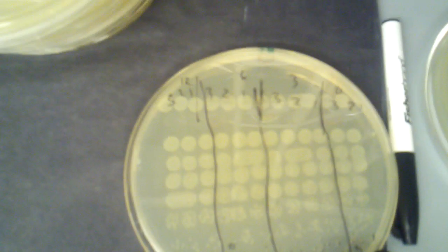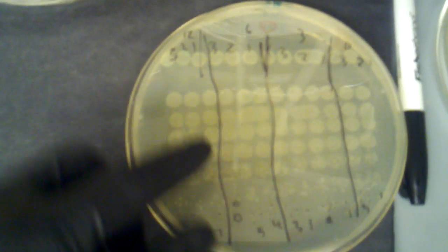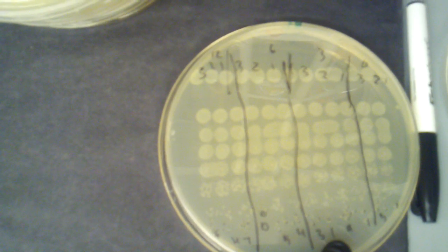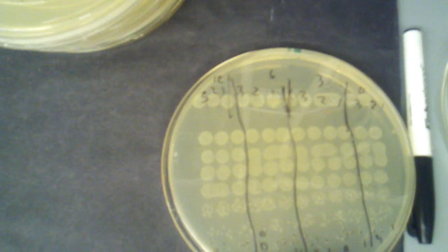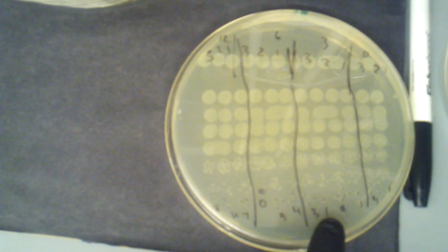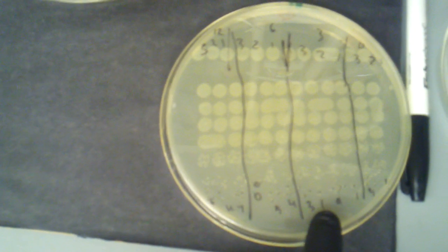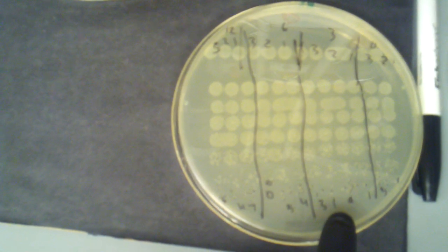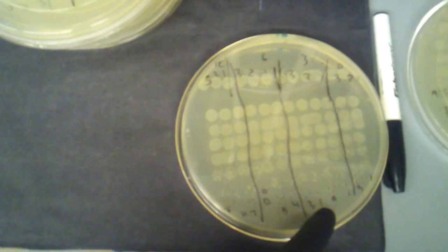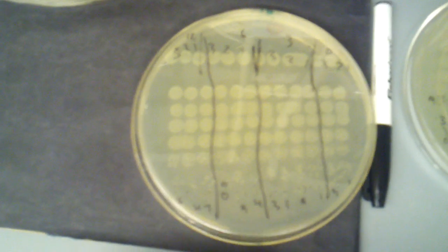And if we were to look down the row at sample 3, 3, which is right here, I think. No, it's right there. We're going to get 1, and that is at a dilution of 10 to the minus 8th, or rather 10 to the minus 10th. So that says that we have one colony at a 10 to the minus 10th dilution, so all we have to do is multiply that number by 10 to the 10th, and that tells us that we have 10 to the 10th cells per milliliter in our original culture. So that's kind of the working principle.